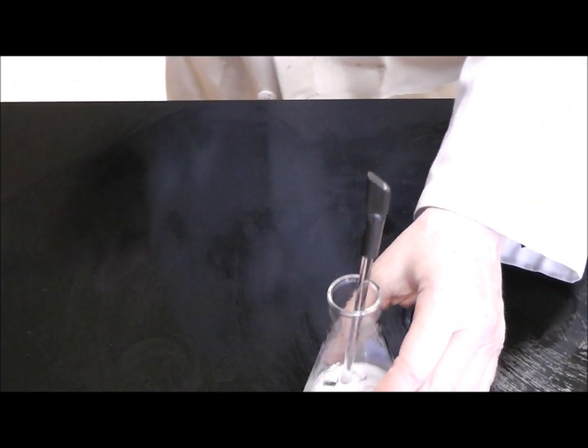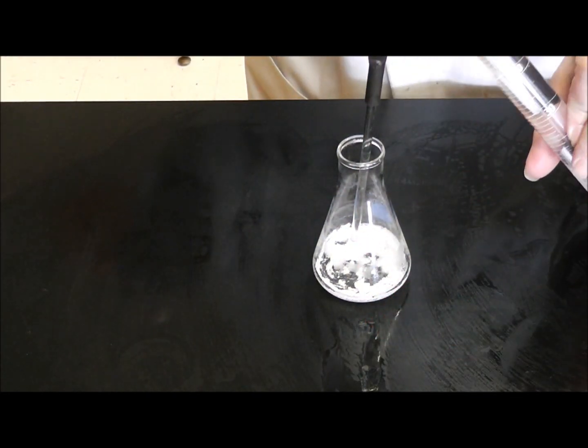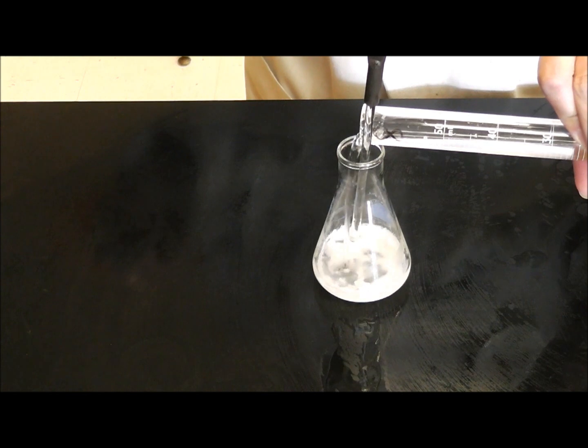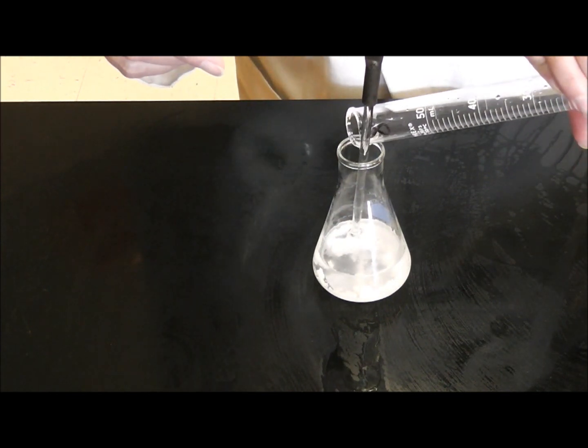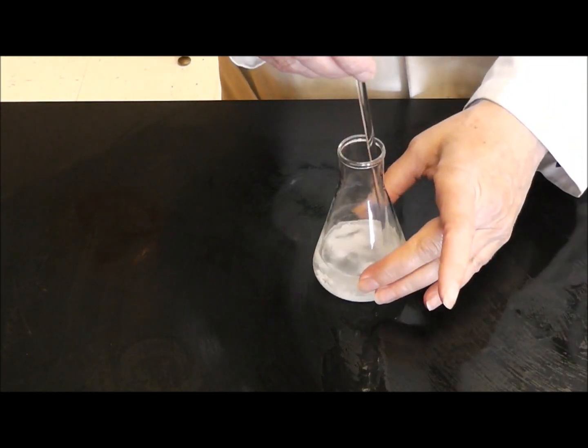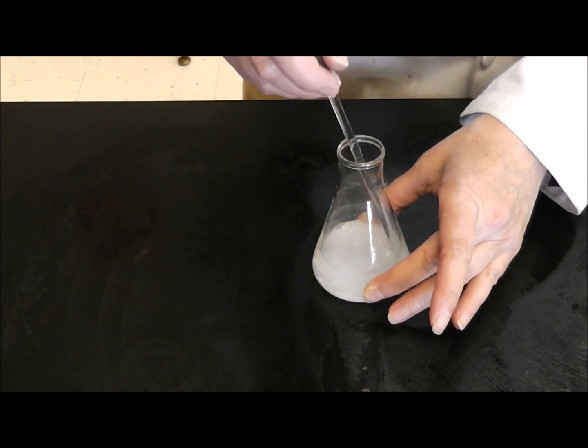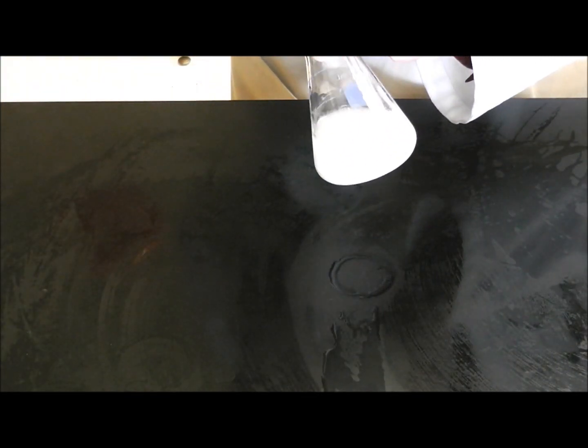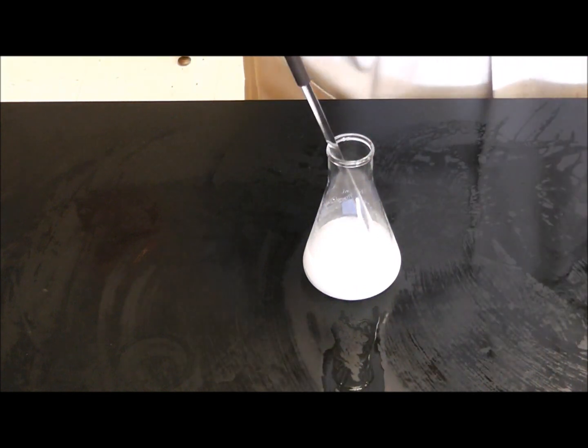What I have got now is, I am going to put my 50 ml of distilled water, cold distilled water, to drive off any excess acetic anhydride. I am going to put this into my Erlenmeyer, and I am going to stir it. Give it a stir. I am going to let it sit for 10 minutes.